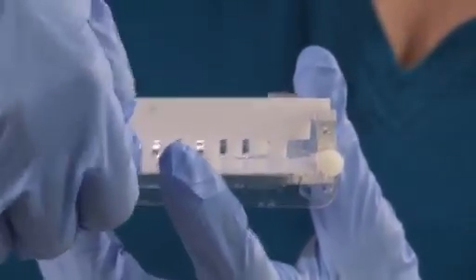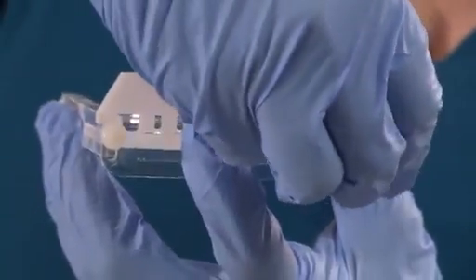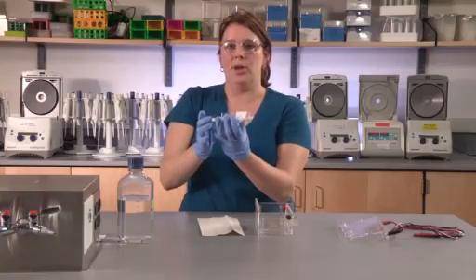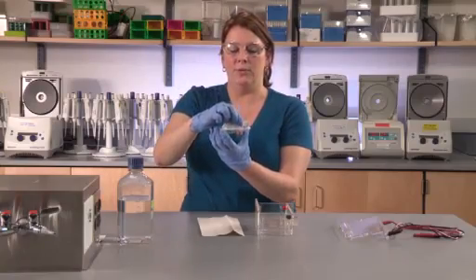Tighten the screws to keep them locked in that position. At this point, remove the comb that was used for the casting of the agarose gel.